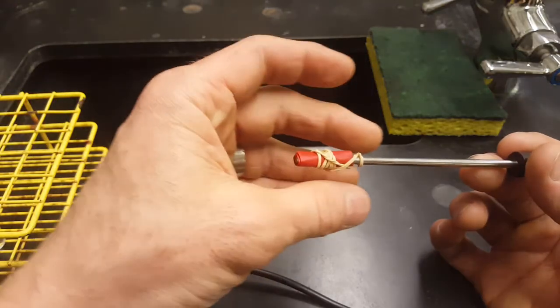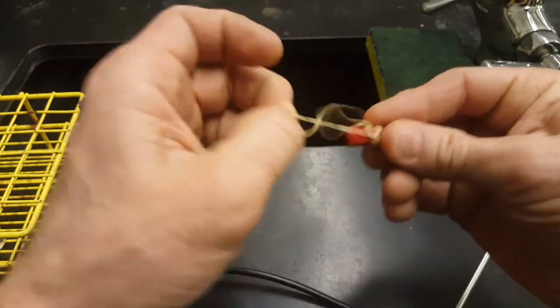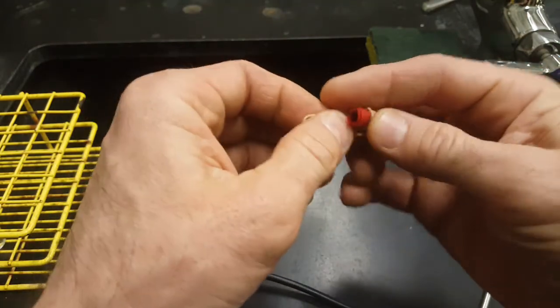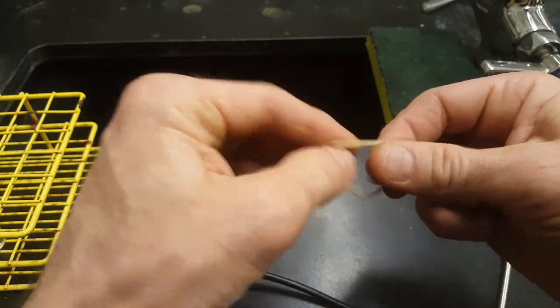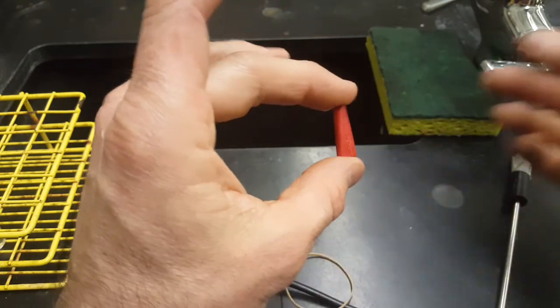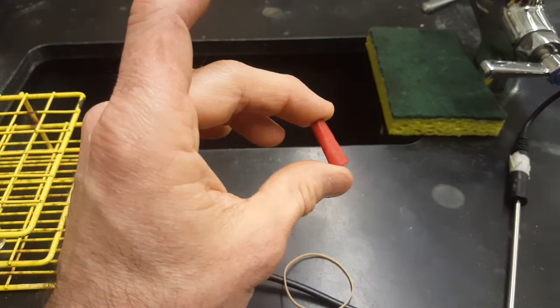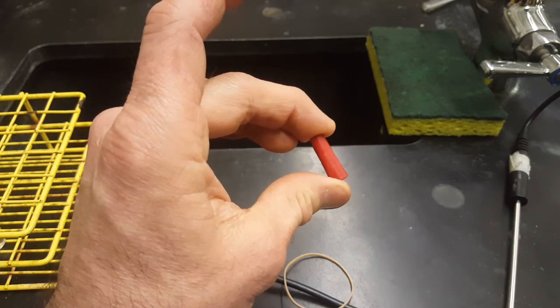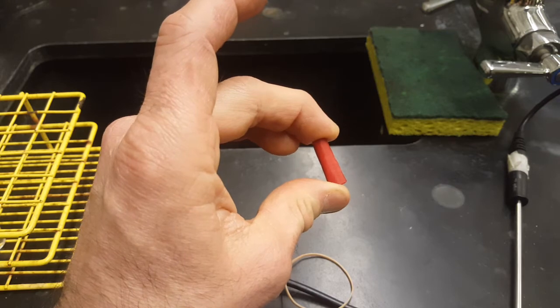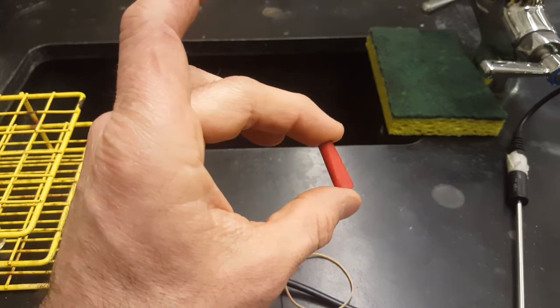To get ready for the second alcohol, just slide this off the end of the thermoprobe. You'll feel the cooling effect of the leftover alcohol on your fingers, but that's okay. It all evaporates into the air. Keep your rubber band for your next alcohol. This guy goes in the garbage. And use your next piece of paper for your next alcohol. You just repeat the entire process. Hit play again on the screen or on your LabQuest, and data will collect automatically.